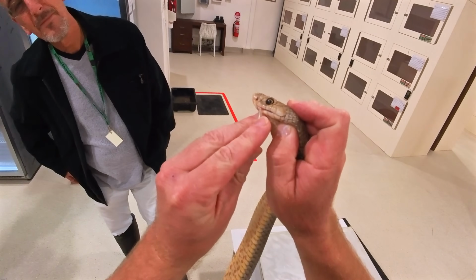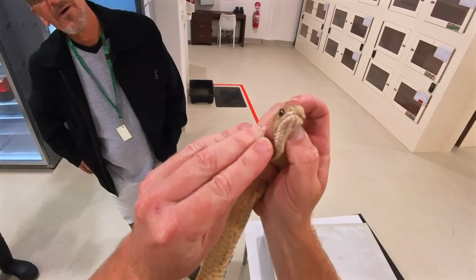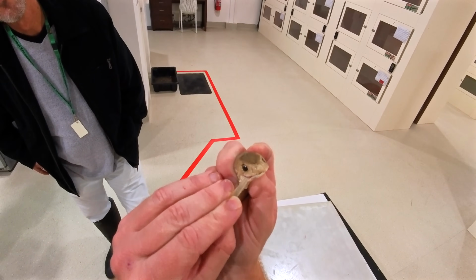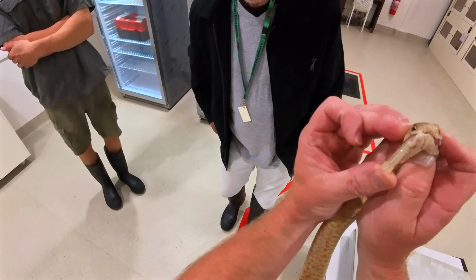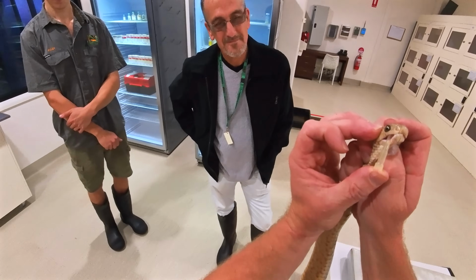So, pipetting the brown snakes at the moment. So it's different to the vial technique we use with the other snakes. This guy's just replacing a fang at the moment on the other side there. So, it's hard getting it on when they're biting. There we go. So you don't get much from the brown snakes. It's only a tiny amount. But what they lack in volume, they make up for in toxicity, that's for sure.